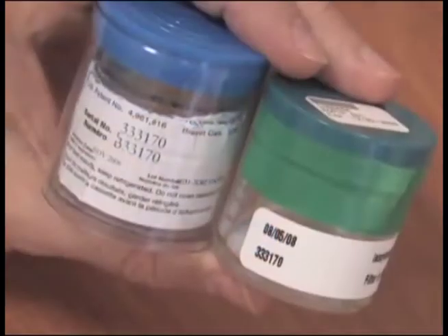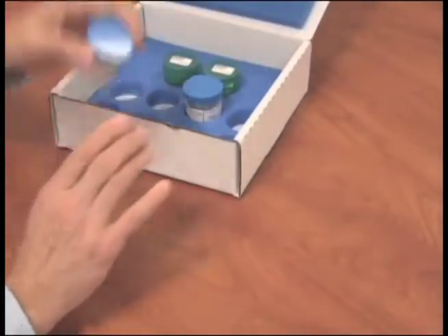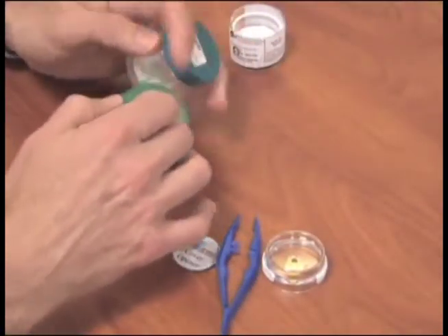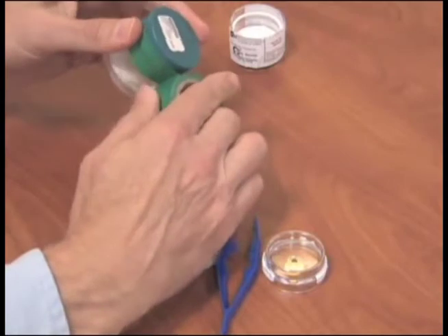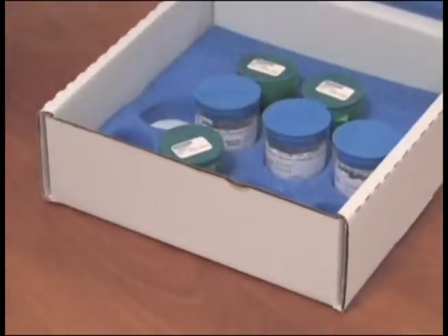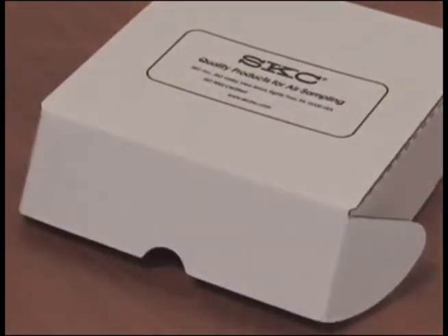Reinstall the top ring and nibs. Ensure the jar and the filter cassette have the same sample ID. Reinstall the cassette into the shipping container and place it in the blue foam packing box. Twist the top on the jar to close tightly and install green tape around the jar lid to prevent the lid from loosening during shipment. Filters must remain in MOPIP solution to ensure the stability of the sample. Place the jar inside the blue foam packing box with the filter cassette. DOT regulations require that the MOPIP solution be packed in these blue foam-lined boxes to absorb the solvent in case of leakage.